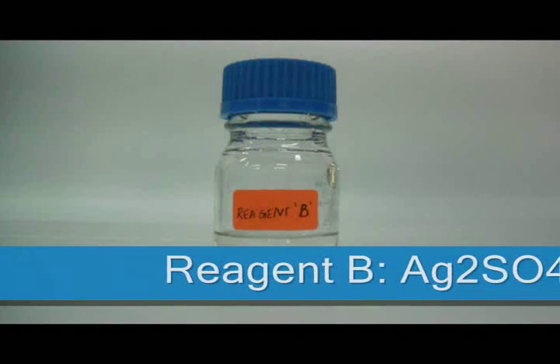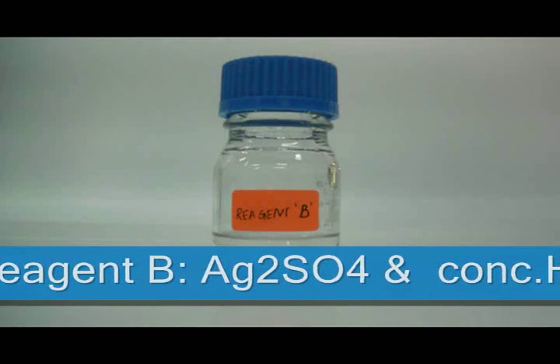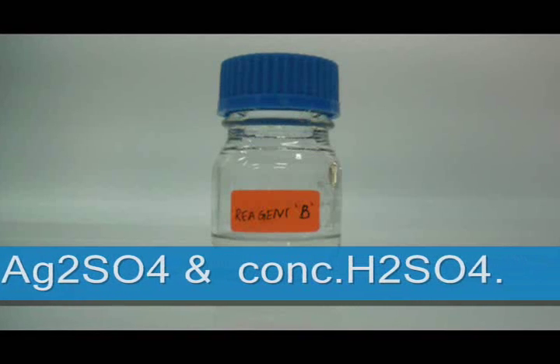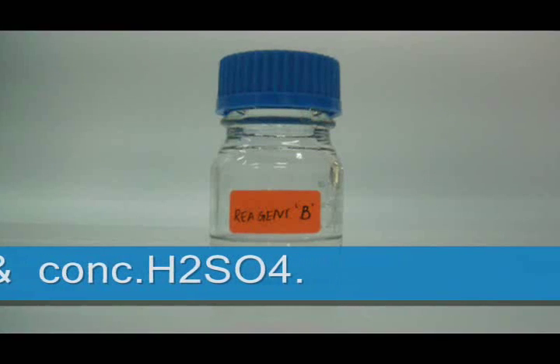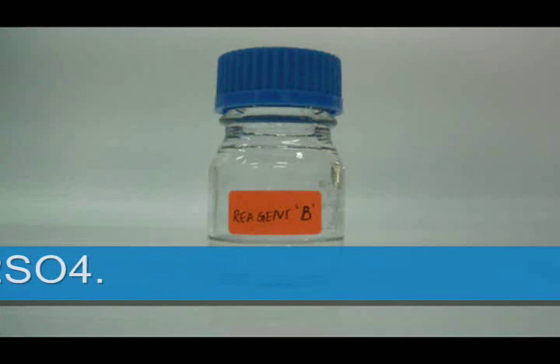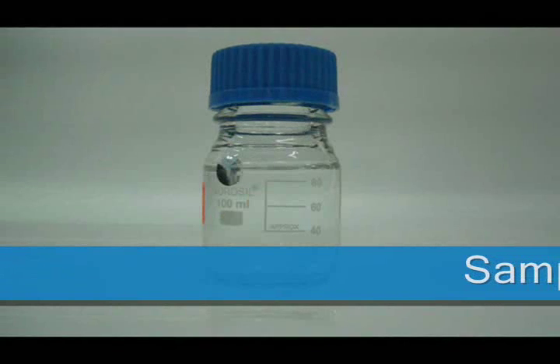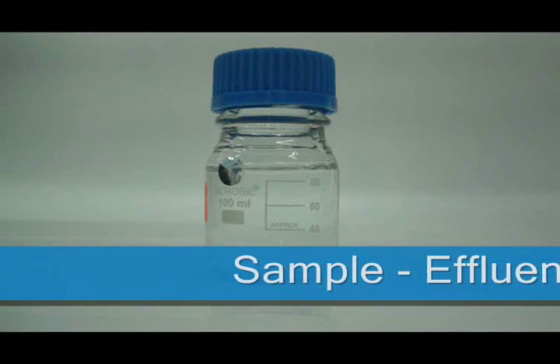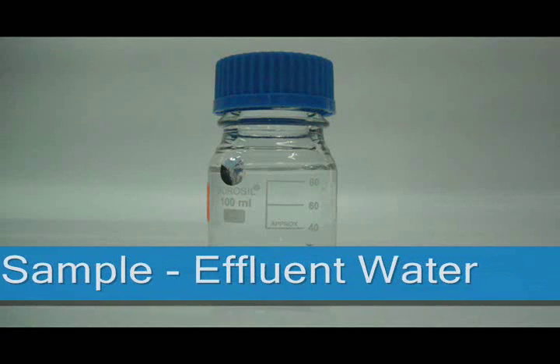Reagent B is a mixture of silver sulfate and concentrated sulfuric acid. The sample is effluent water.